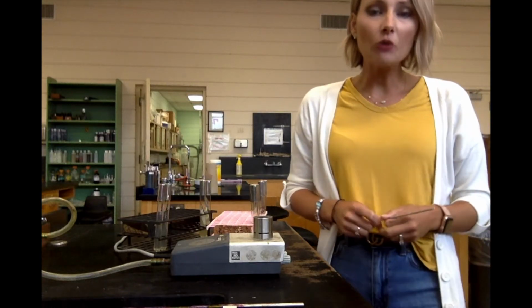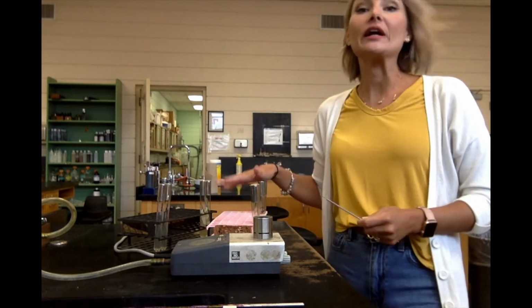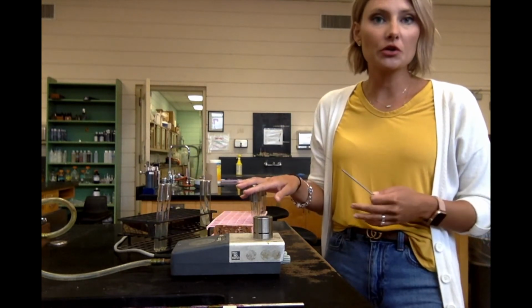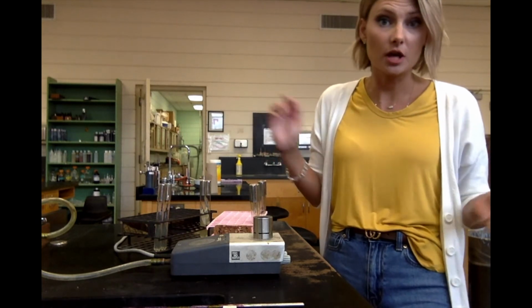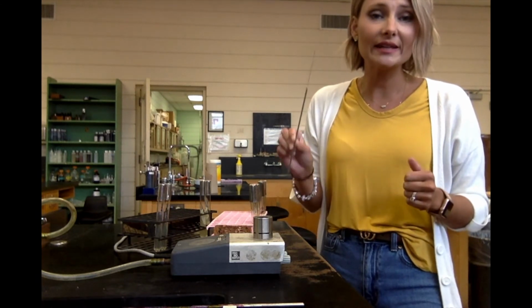All right, so we are over here at the workbench, and I'm going to show you how to inoculate a motility stab. I have the results for 3 different bacteria to share with you, the 3 results that we went over, but I'm only going to show you the inoculation process on one, because there's no sense in me doing it 3 different times. So, of course, we want to use aseptic technique, and the tool that we're going to use to do this is an inoculating needle.